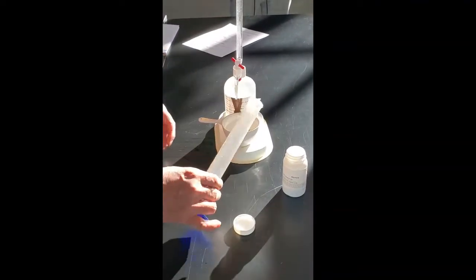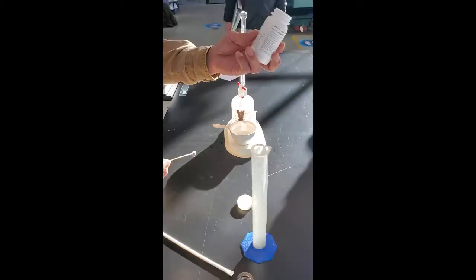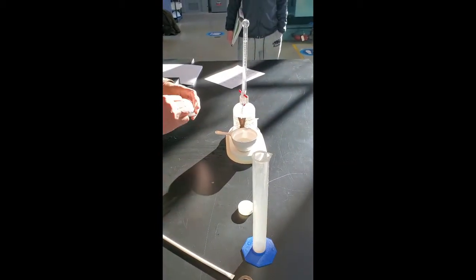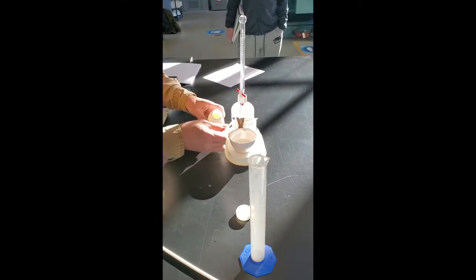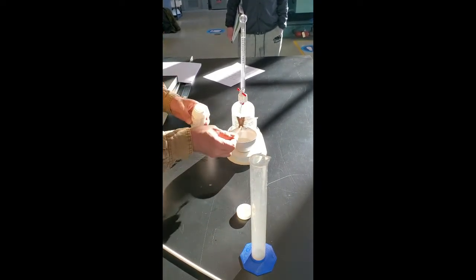And a few scoops of starch indicator. One, two... I think it called for three of them. We don't have too much.